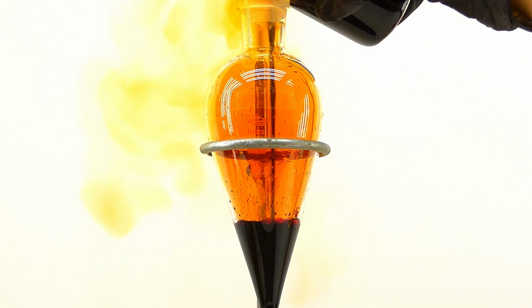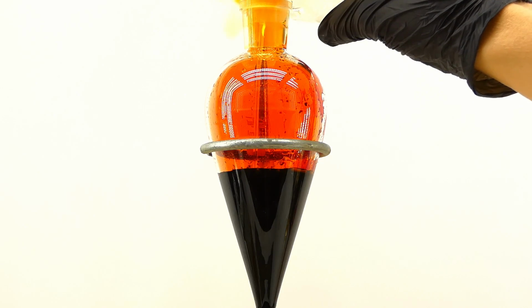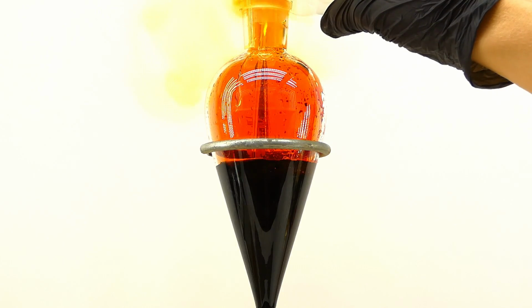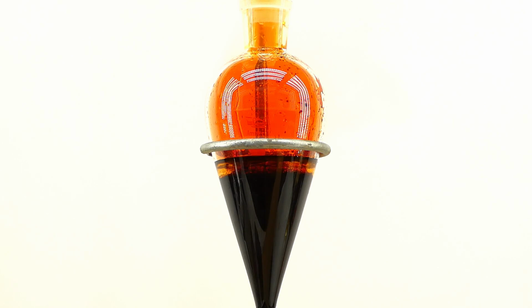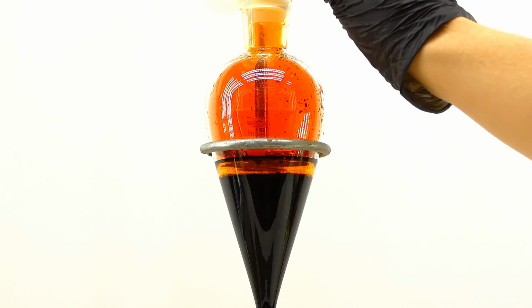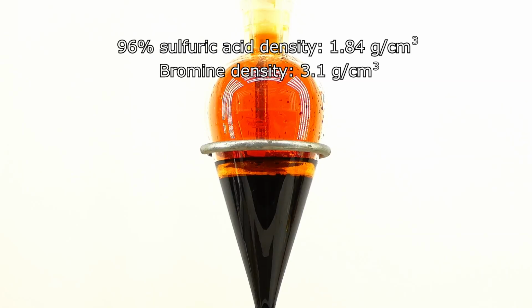So I got it back to the separatory funnel and poured in roughly a third of its volume in concentrated sulfuric acid, which should hold on to any remaining water. It actually sat on top of the bromine, and that felt really weird, because it's a very dense liquid, but it turns out that bromine is even denser, being more than 3 times as dense as water.